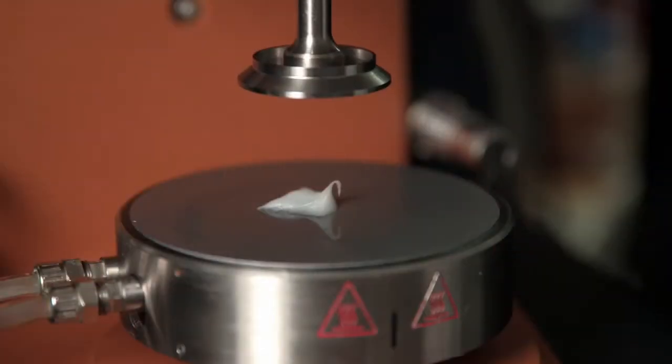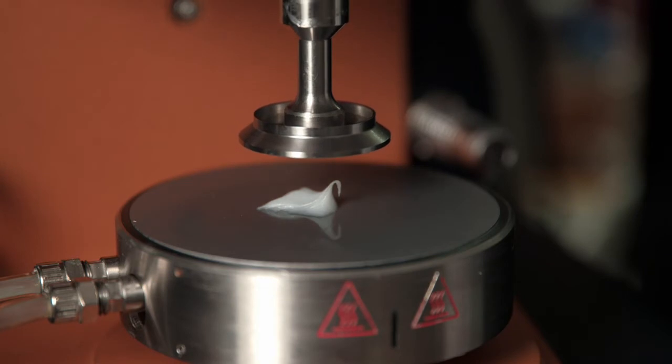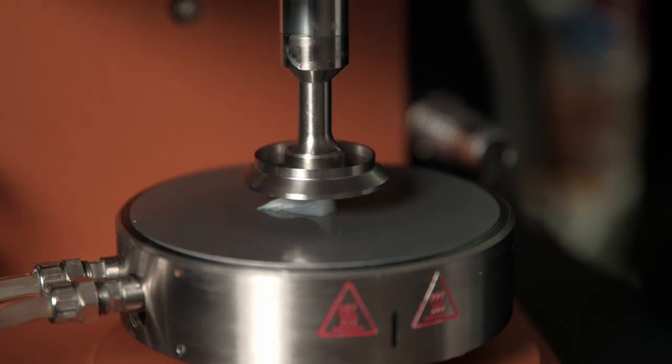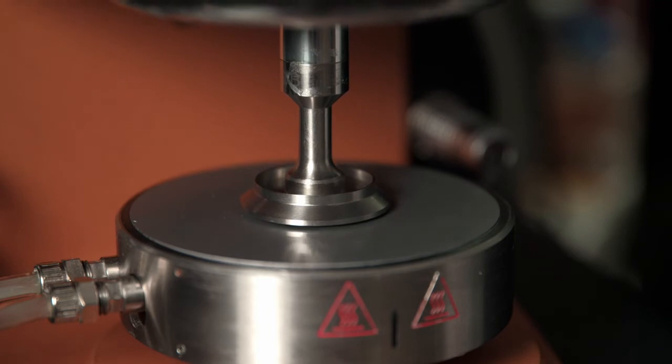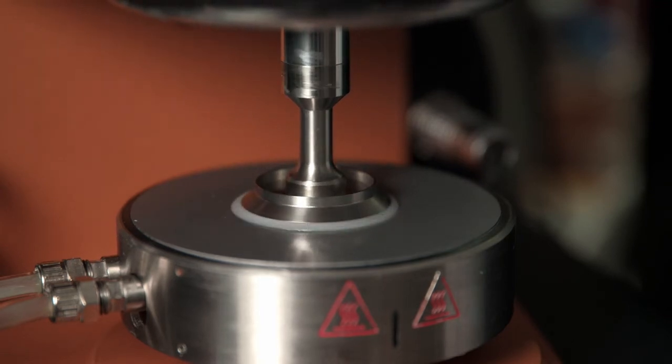There are a number of rheological evaluations that are appropriate for topical formulation development, including a shear or frequency sweep. An appropriate amount of formulation is added to the plate, and a geometry is chosen. In this case, we are using a 40 mm parallel plate with a 250 micron gap.